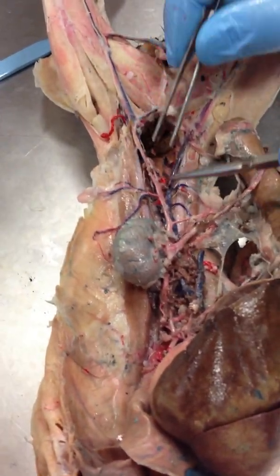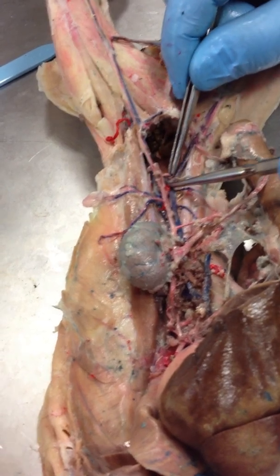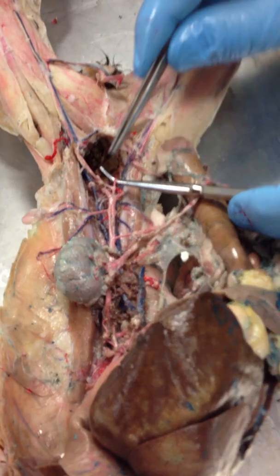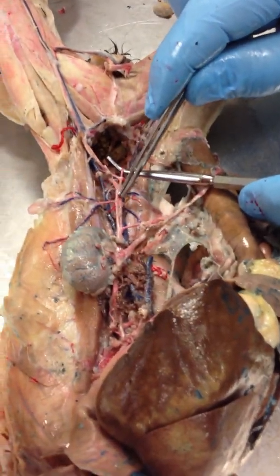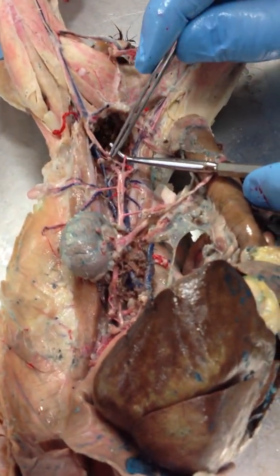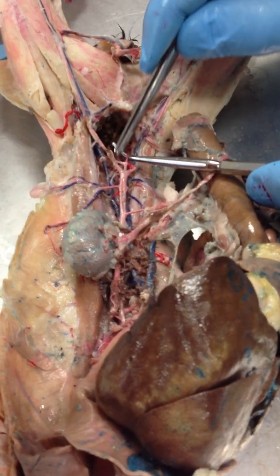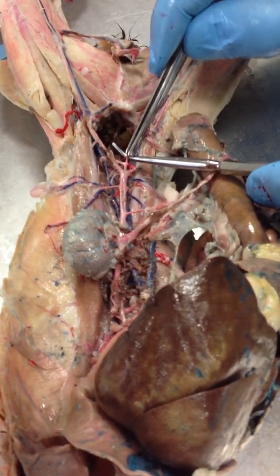You can see that we have one artery that continues down, and this is our caudal artery. So: descending abdominal aorta, left external iliac artery, left internal iliac artery, and then caudal artery right there.